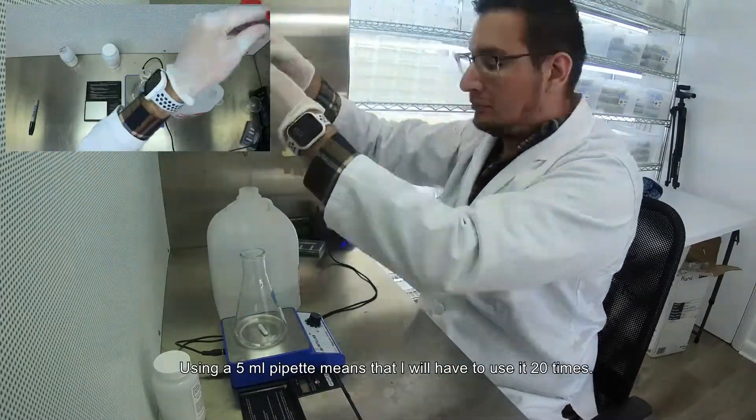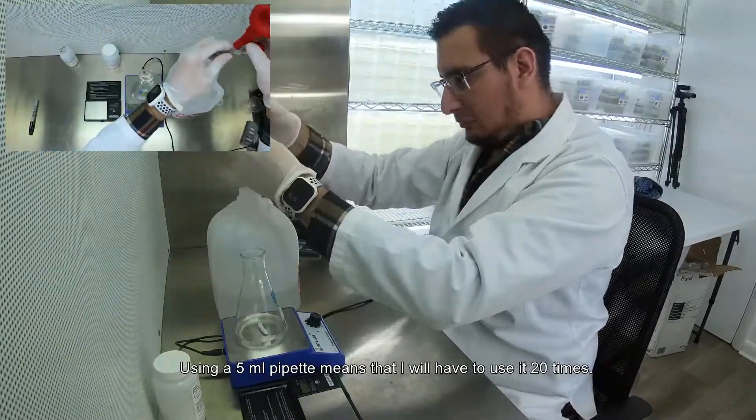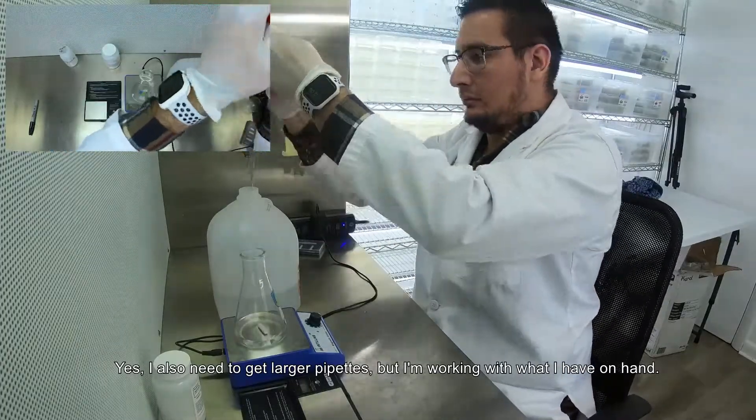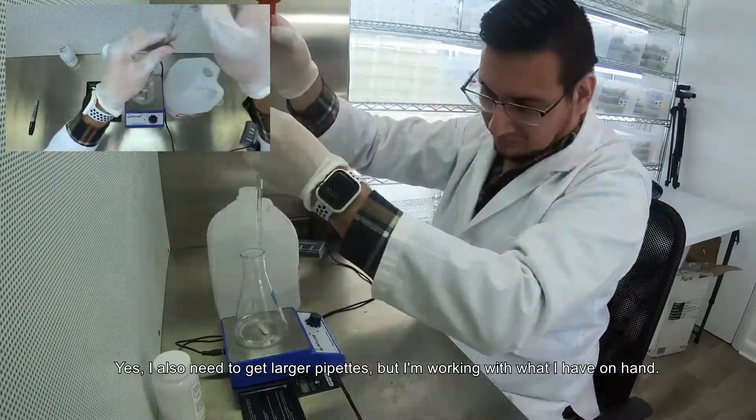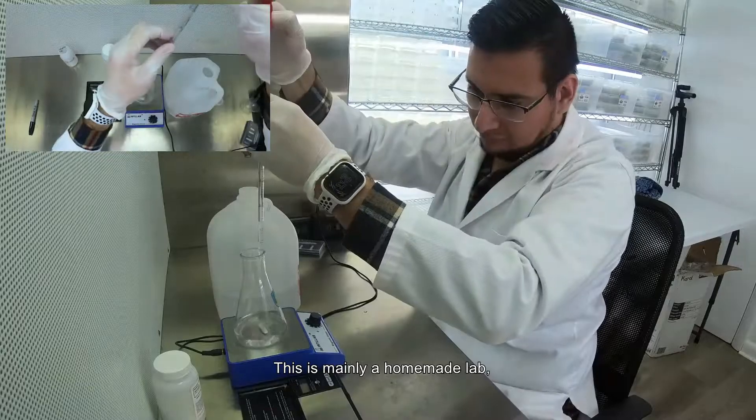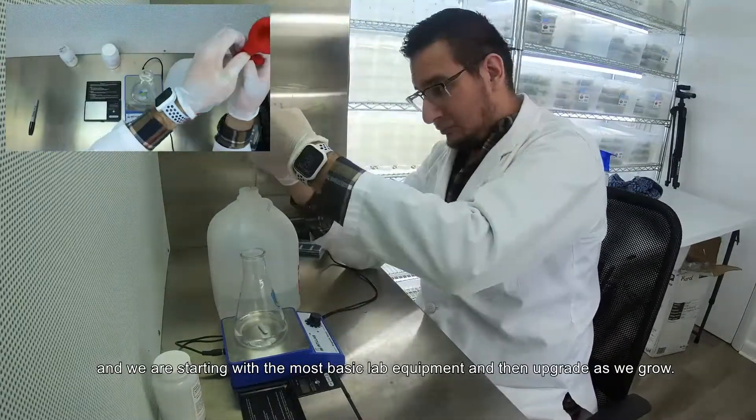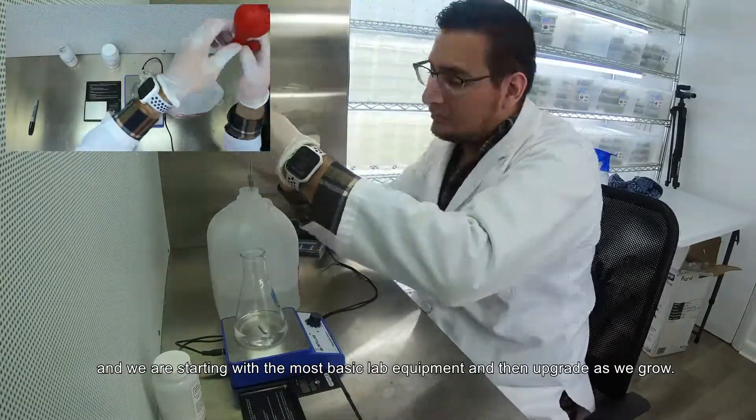Using a 5 ml pipette means that I will have to use it 20 times. Yes, I also need to get larger pipettes, but I'm working with what I have on hand. This is mainly a homemade lab and we are starting with the most basic lab equipment and then upgrade as we grow.